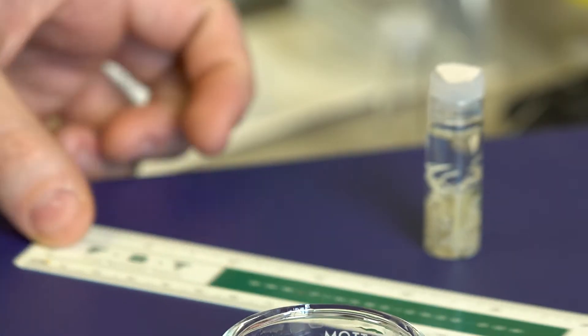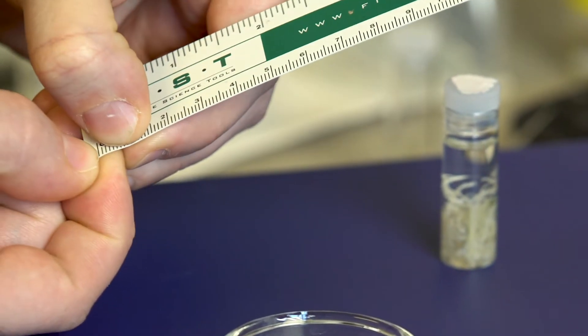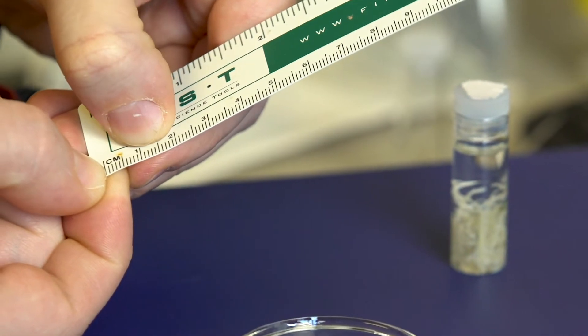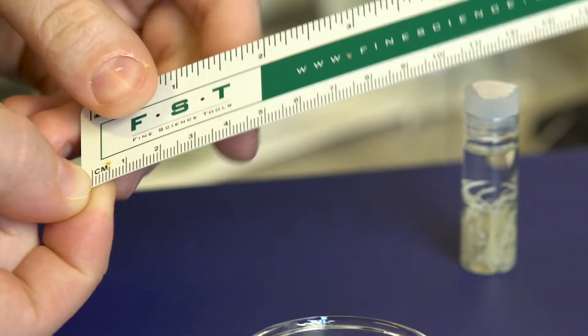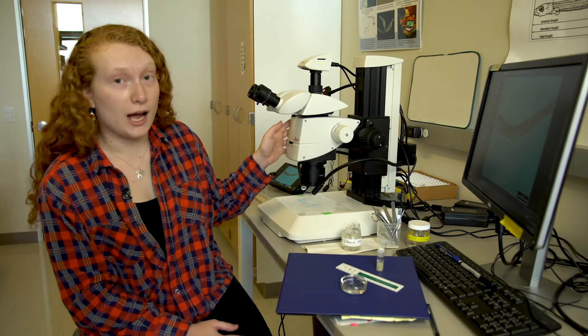Because your fish are so small, millimeters in size, they can be anywhere from 2 to 10 millimeters at hatching size which is really small. Not microscopic but not easy to see with the naked eye. You need a high-powered microscope.